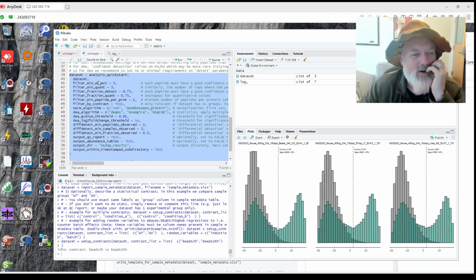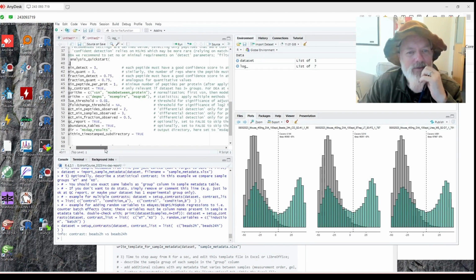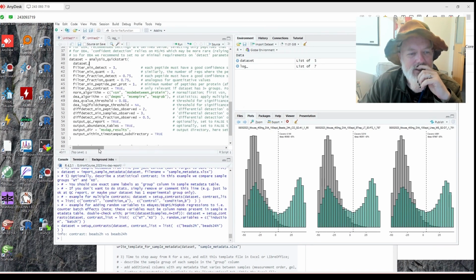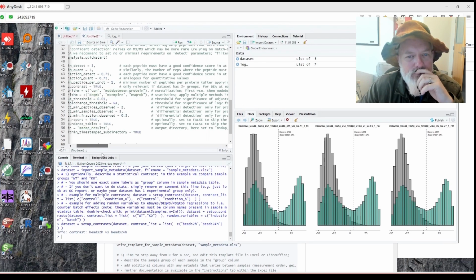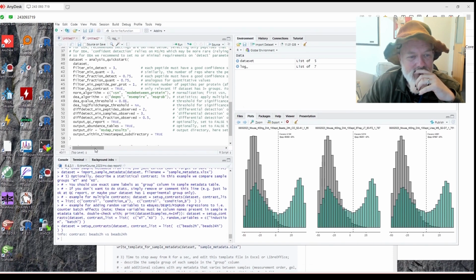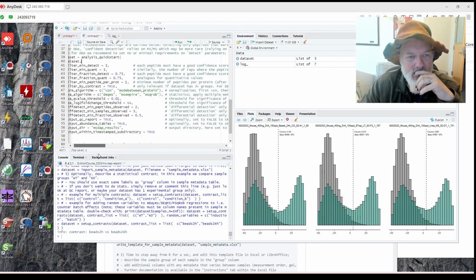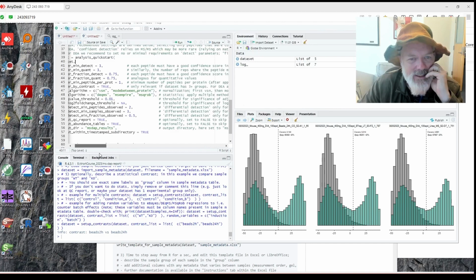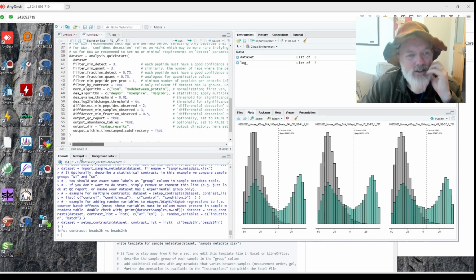And basically before I do that, these are the default filter settings, but you may want to play around with this. So this is minimum detect equals 3. Each peptide must have a good confidence score in at least n samples per group. Mine has like 10 samples per group, but you may want to edit this, like maybe to 7. Similarly, the number of reps for the peptide must have a quantitative value. Filter fraction detect: each peptide must have a good confidence score in at least 75% of samples. So either 3 or 75%. I think that's pretty reasonable.